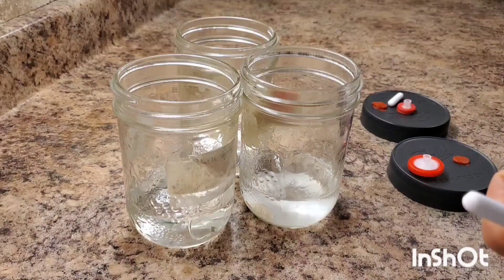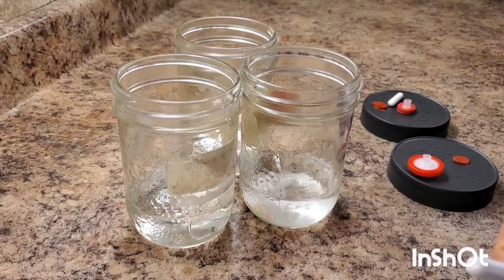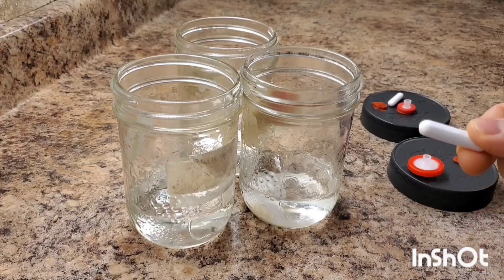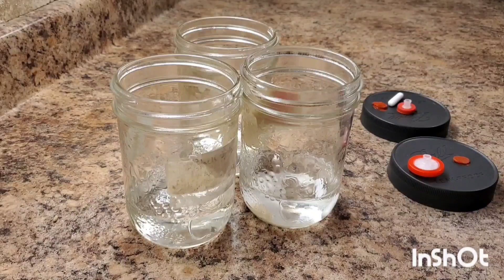You want something to break up the mycelium because we're going to have to stir this every day or two. As it breaks up the mycelium, it will keep growing from those broken pieces and just keep expanding pretty much infinitely. It will also help to oxygenate your liquid in there, which you'll have to do after you pressure cook it.